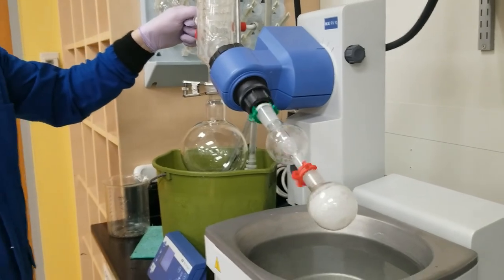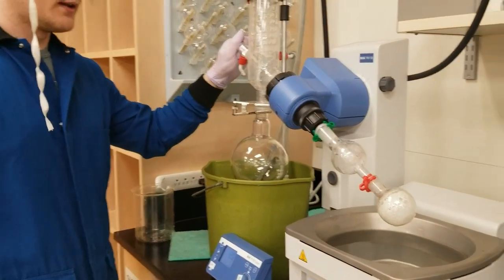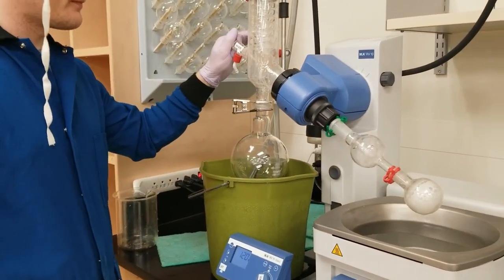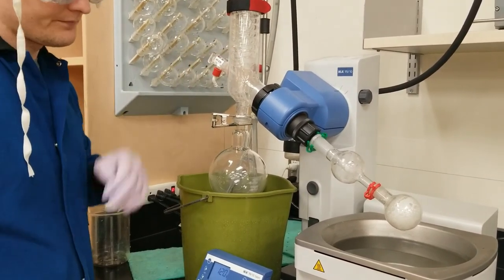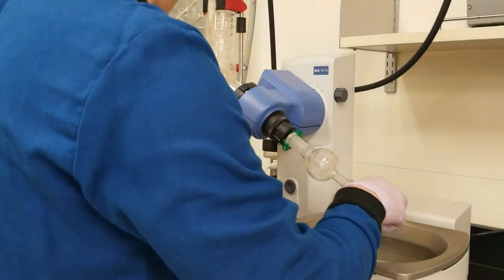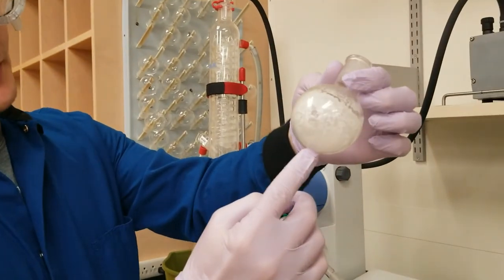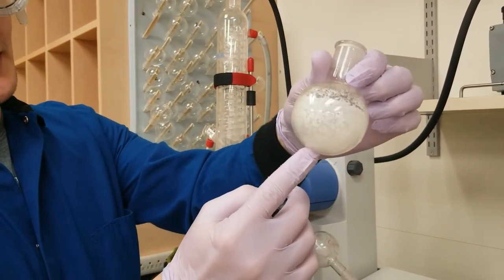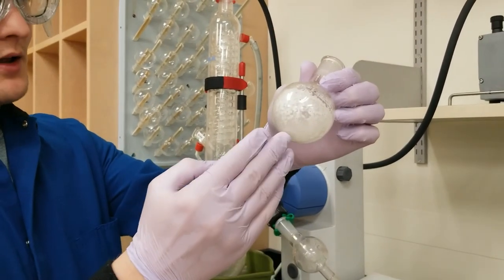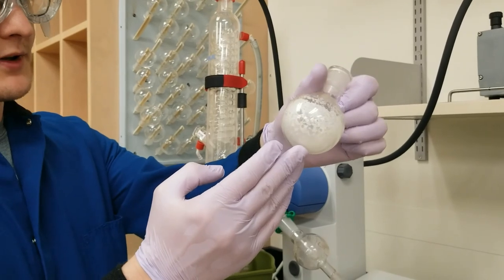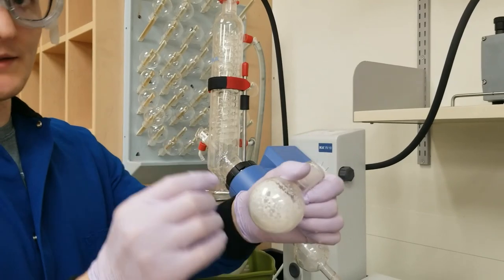Such a quick way to remove 20 mls of ether. In order to get that thing off, let's kill the spin, kill the vacuum, and gently let the air back into the system. And ta-da! This is really nicely dried. I can see a little sparkle on the crystals of solid that I have here, which is promising that it's nice and dry. So this is my acetanilide product, which I'm going to get a weight and a melting point for you guys.